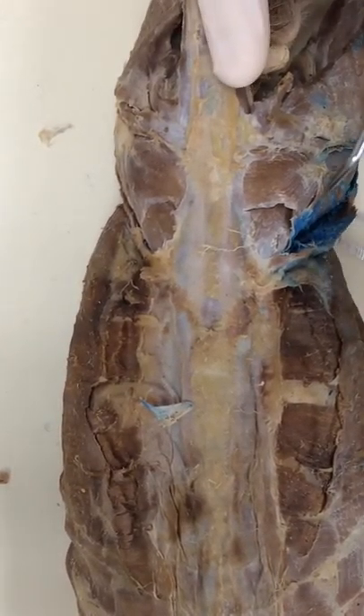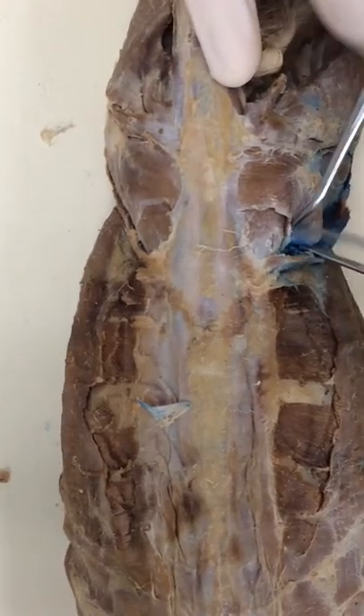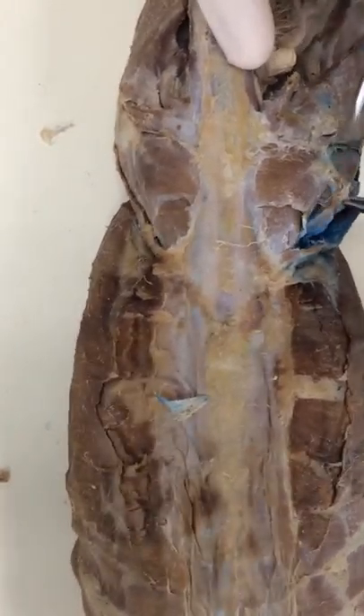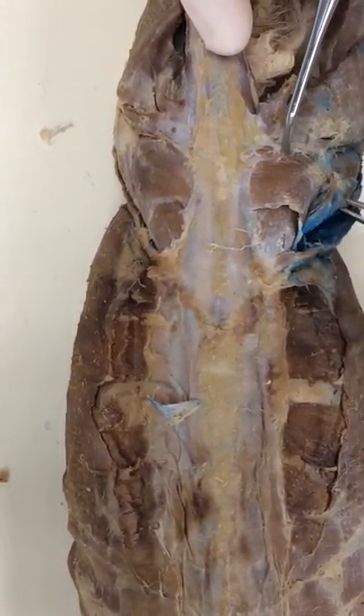There's medius, and then you'll find tensor fascia — there's just a little smile right here. All I need you to do is free up the top margin of it. Push and pull, push and pull — break the connective tissue. Now since the tendon's missing, I'm going to leave this little piece here so it doesn't roll off. There's tensor fascia right there.